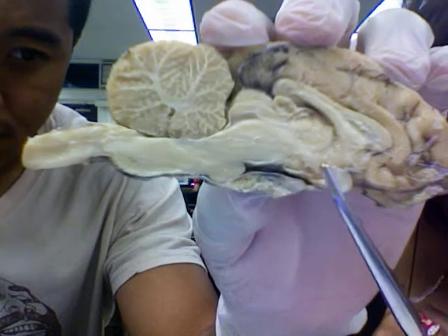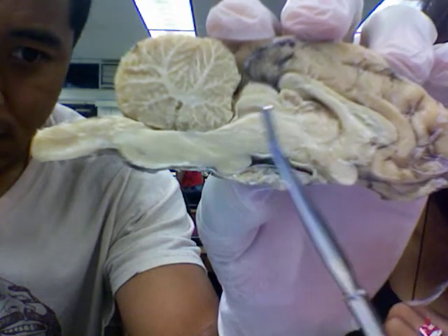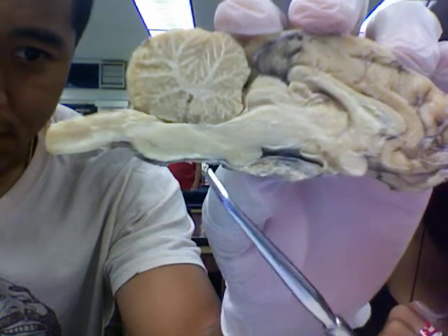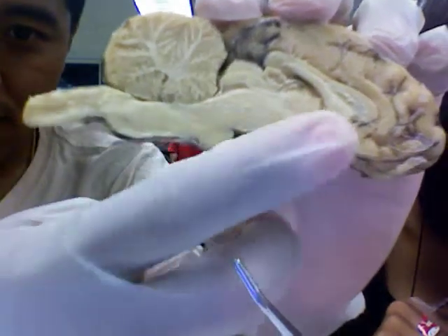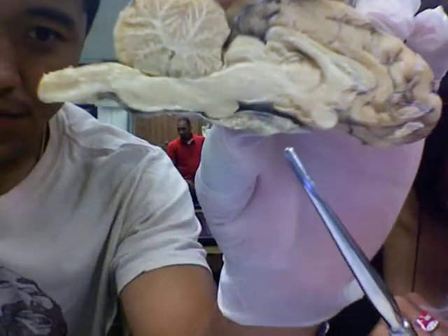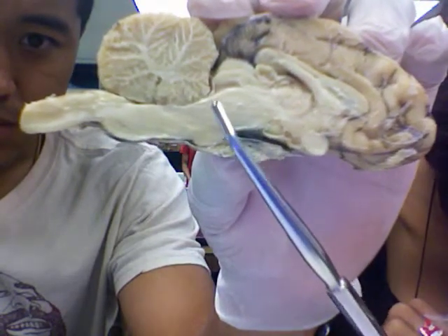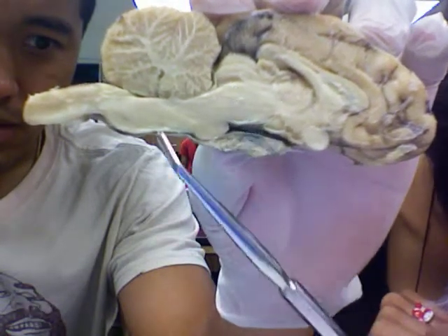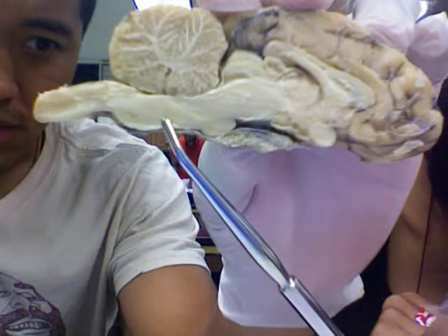And then 15 is the third ventricle, which would be right here. 16 is this thing — yeah, okay, not that part, this part. And then 17 is the cerebral aqueduct, which is in here. And then the fourth ventricle is like somewhere in here, and then the medulla oblongata.